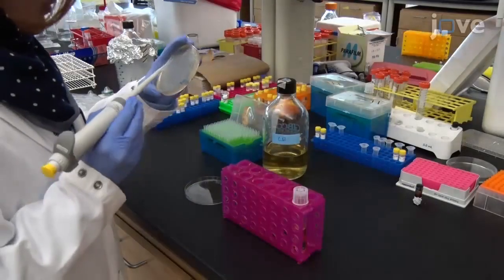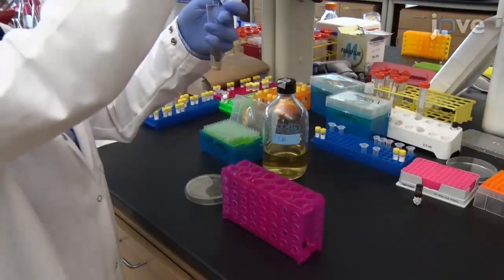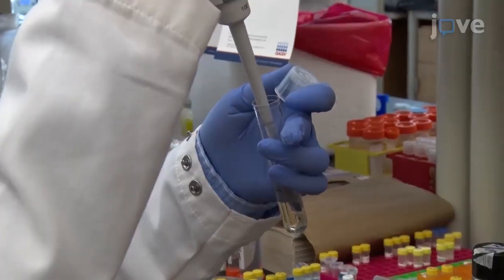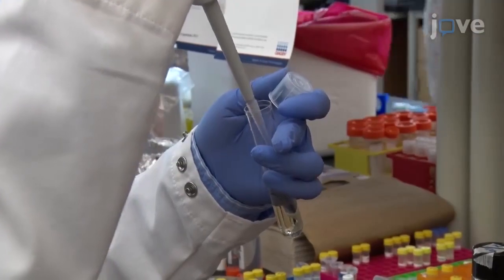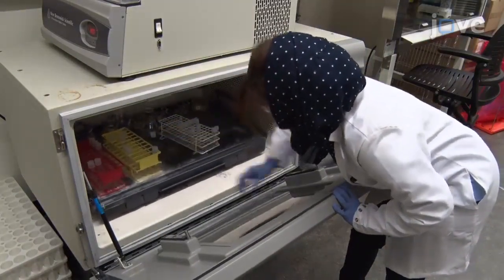The day before the experiment, seed 5 milliliters of LB medium, supplemented with kanamycin and carbenicillin, from a fresh bacterial colony using sterile techniques. Incubate all cultures overnight at 37 degrees Celsius with agitation.